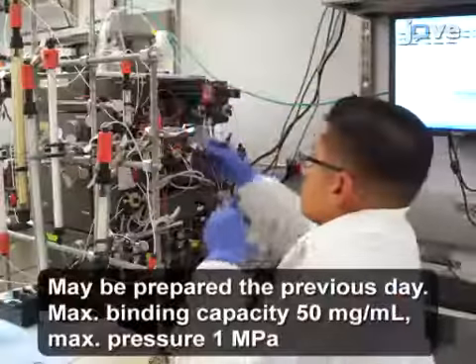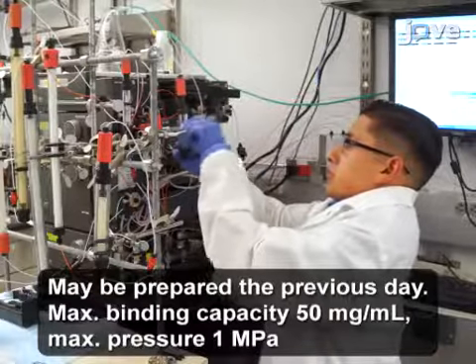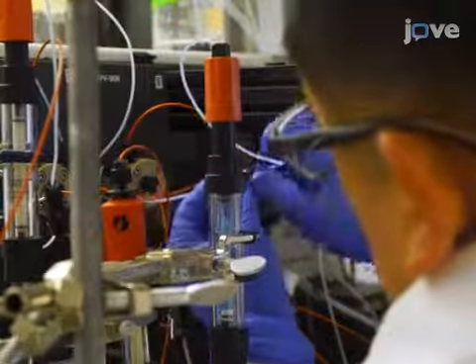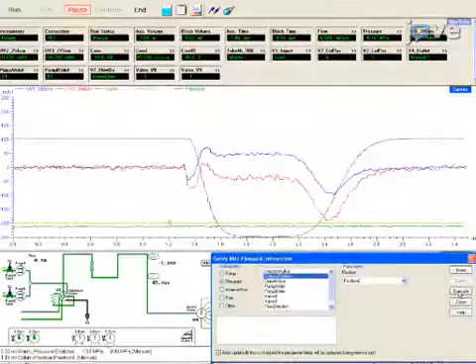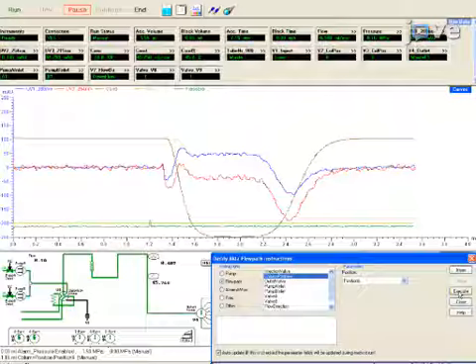Next, set up the 110 mm long, 5 mm diameter FPLC column with a 1.5 milliliter nickel charged resin. First, connect the column to the FPLC instrument and apply buffer. The instrument should be collecting real-time data of conductivity and UV absorbance at 280 nanometers. The conductivity and UV readings should stabilize. If necessary, continue to flow buffers through the column until readings are stable.